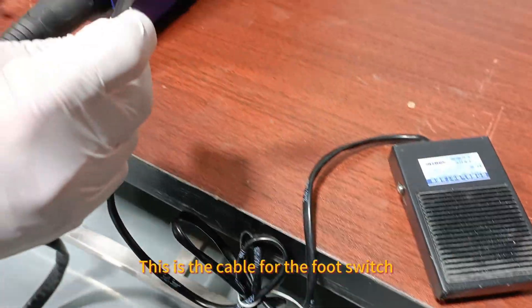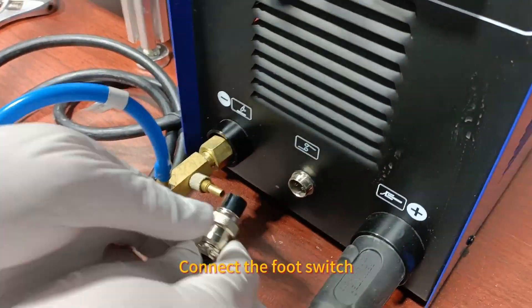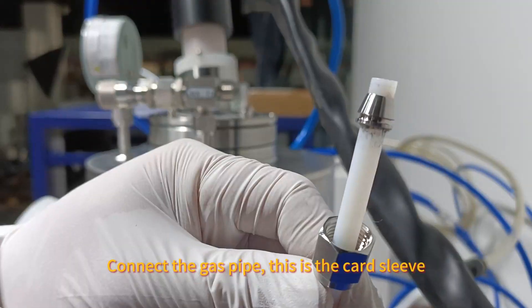This is the cable for the foot switch. Connect the foot switch. Connect the gas pipe.